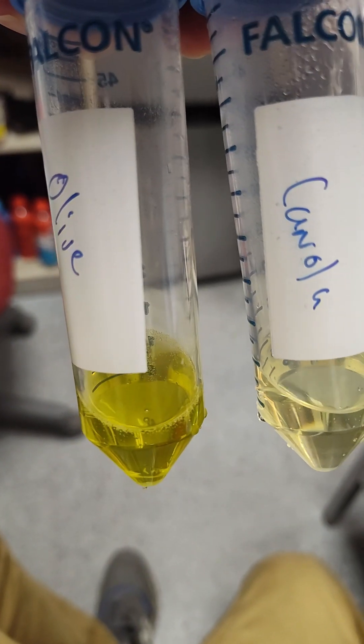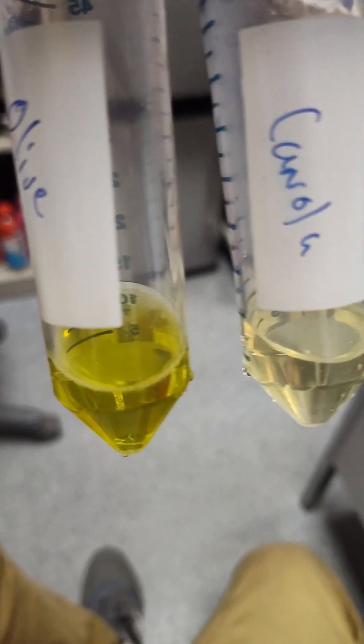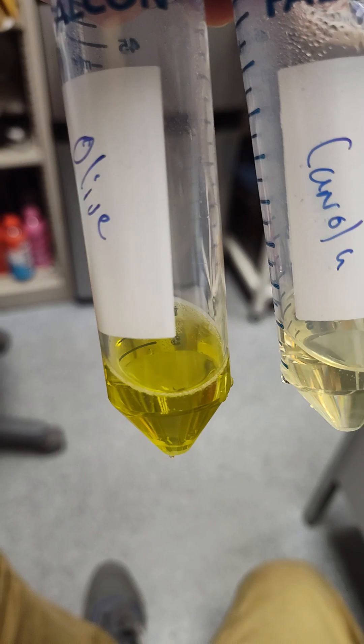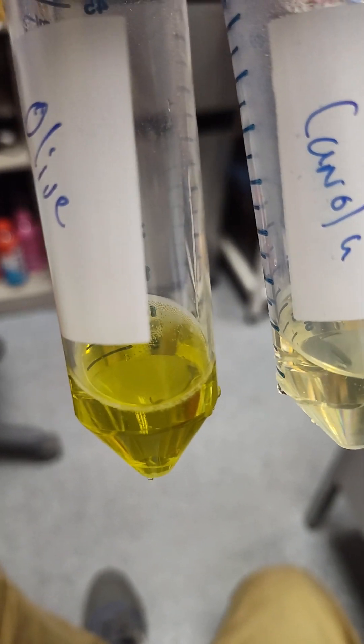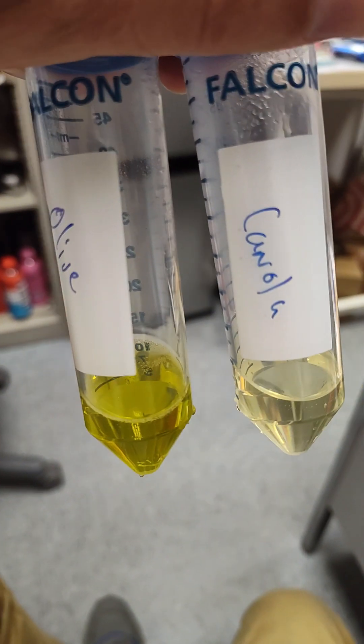Really good now. So I just vortexed them a bit and then sonicated them. As soon as you sonicate all that dissolved gas just comes right out. And you know what? It looks like olive oil. Well, definitely not extra virgin olive oil. Just plain regular olive oil and canola oil. Good starting point.